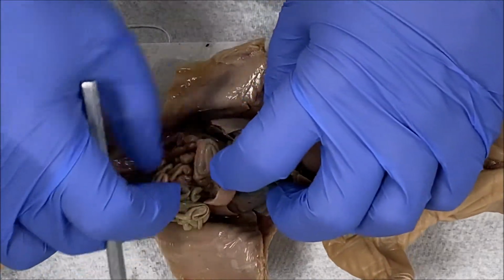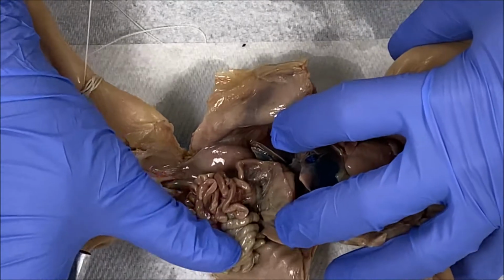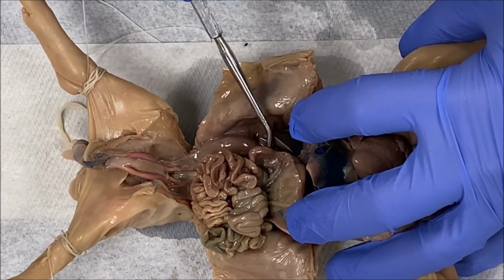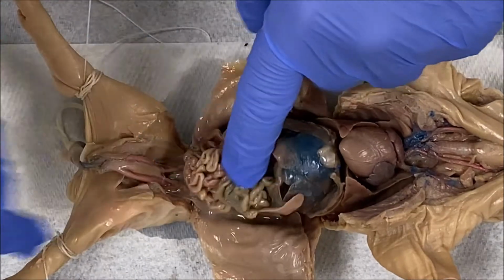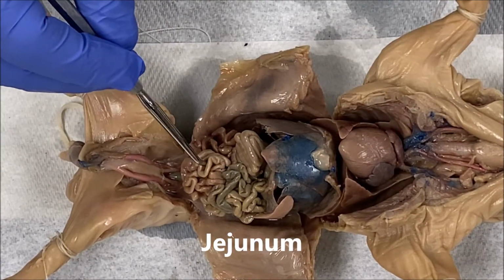And then the first part of the small intestine that's attached to the stomach, so if I can clearly see, if I can lift that. So here's the stomach. Here is the first part of the small intestine attached to the stomach. This is called the duodenum. The part of the small intestine that's pretty much just in the middle, this is the jejunum.